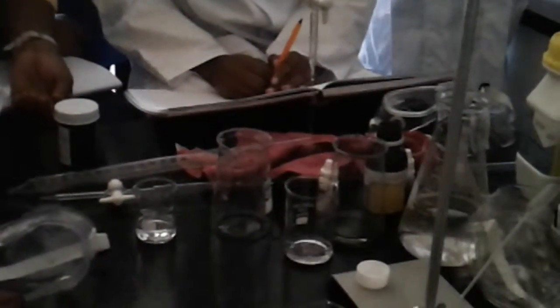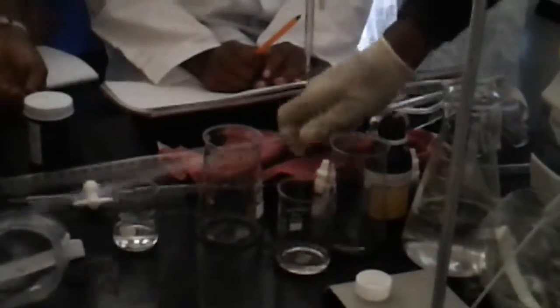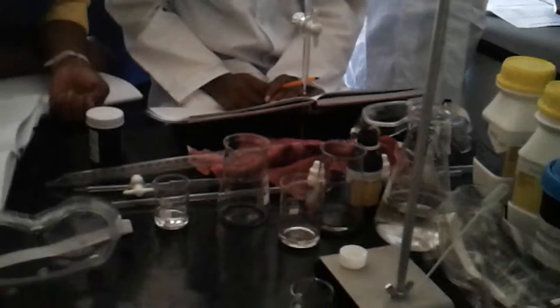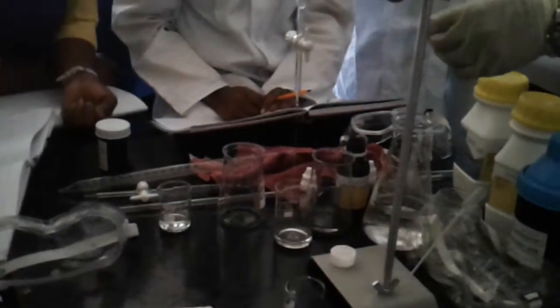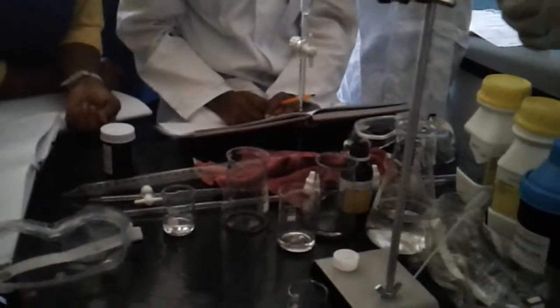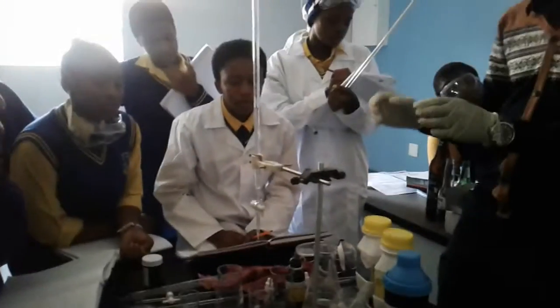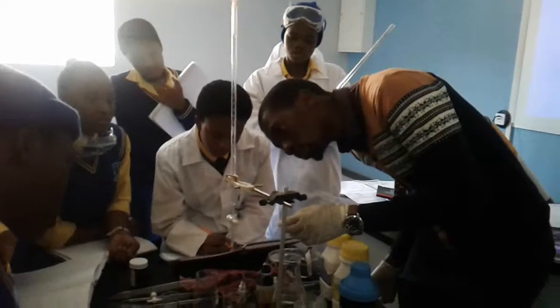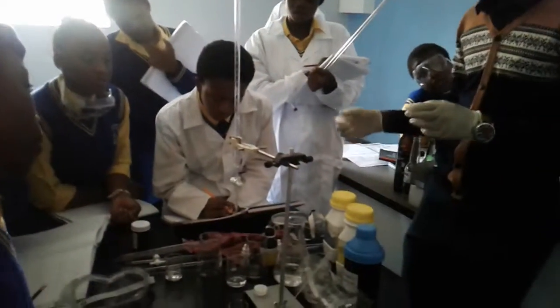It comes out, so that we get accurate results. And another thing, we wanna put it drop by drop. We're not gonna pour everything at the same time. Drop by drop. I hope you guys are taking notes. Okay, tell me when it gets to 0.